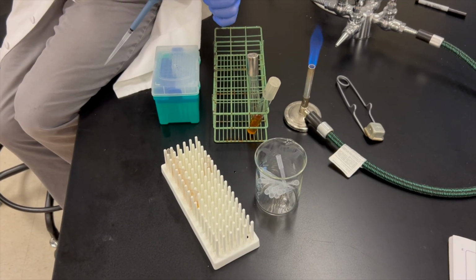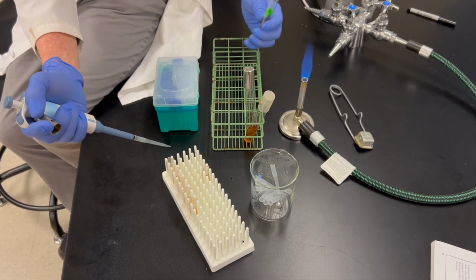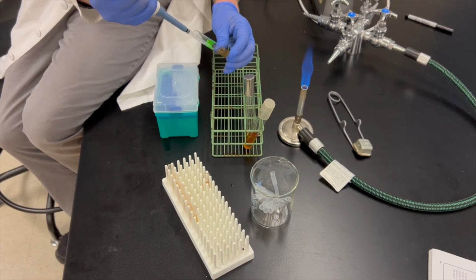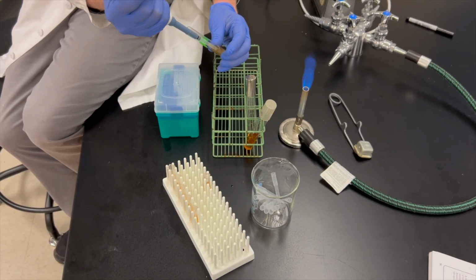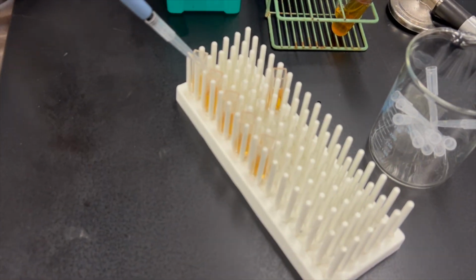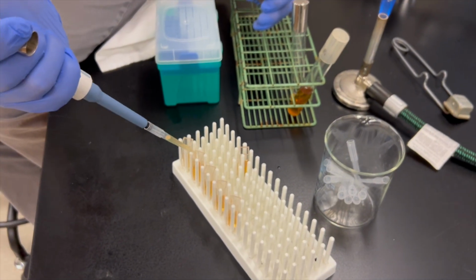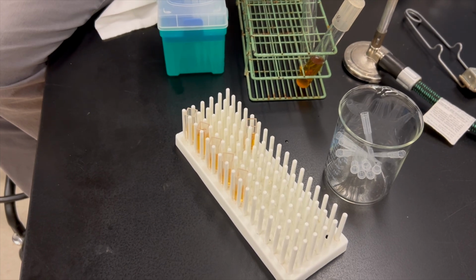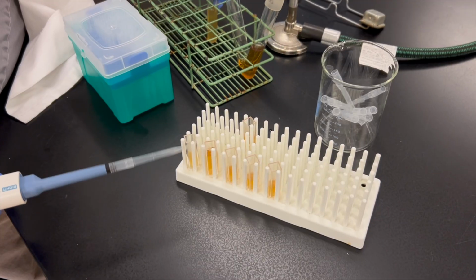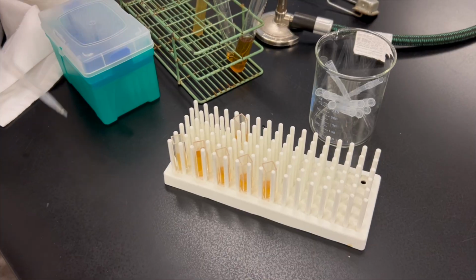All right, so now what I'm going to do is leave that one set with 1.5 mLs. I'm going to do a second batch where I take this one and add the same amount to the second tube. So here's 750 microliters. And now here is 1.5 mLs. So this tube has now been diluted 1 to 2. It has 3 mLs in it. This tube only has 1.5 mLs in it. This is my undiluted sample.